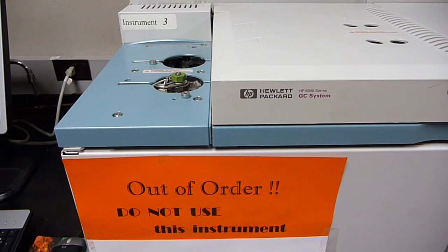As with any repair of electrically powered equipment, please follow safe and prudent protocols. I never work on the innards of a GC without the first step being unplug the electrical power cord of that GC. And also, you may have to, in a safe manner and procedure, stop and disconnect the flows of the gases to the GC.